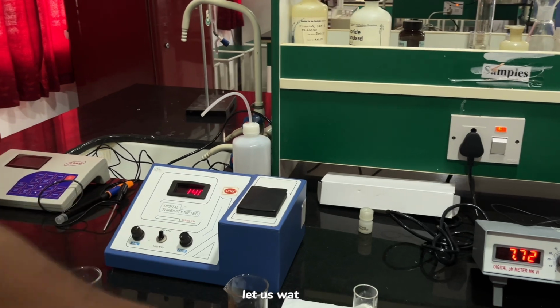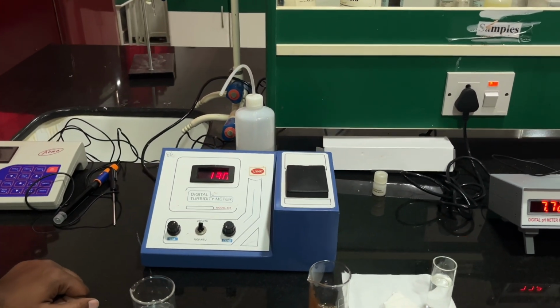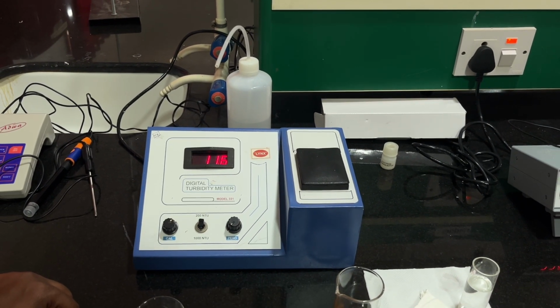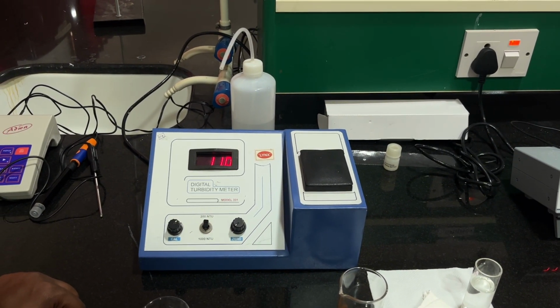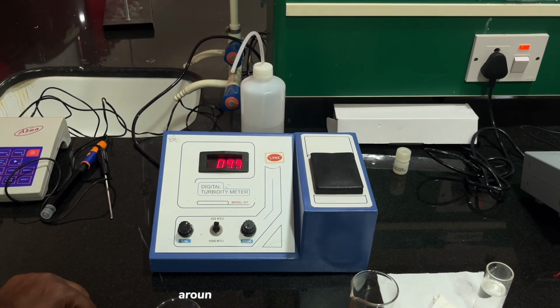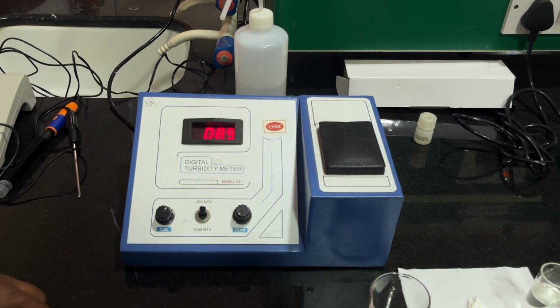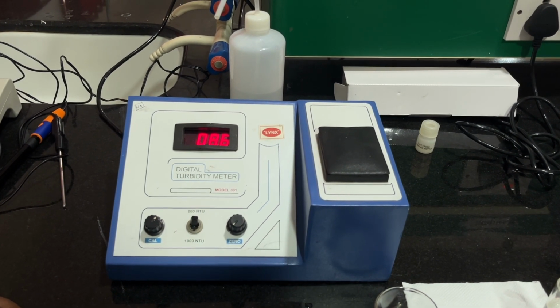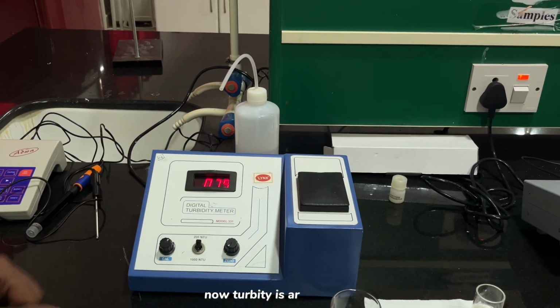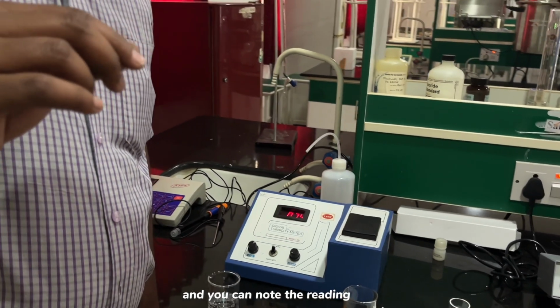Let us watch. The turbidity is getting measured. So you can see, around 9.8, and it is reducing drastically. Now the turbidity shows around 7.9, and you can note the reading 7.9.